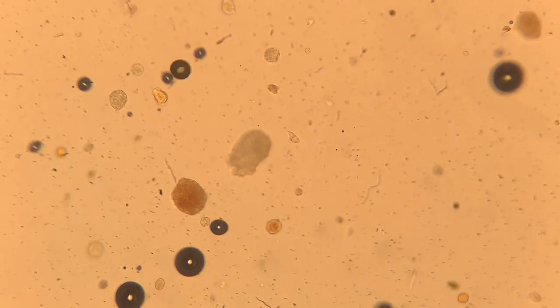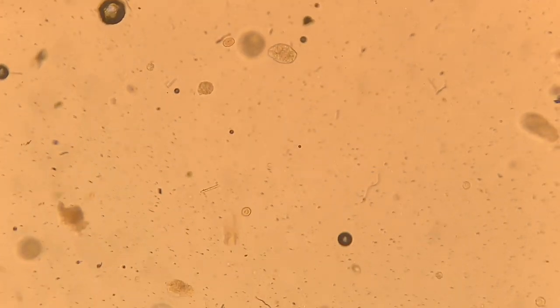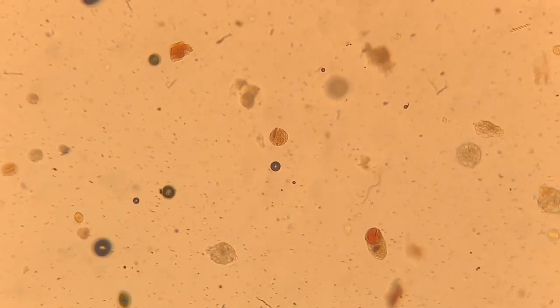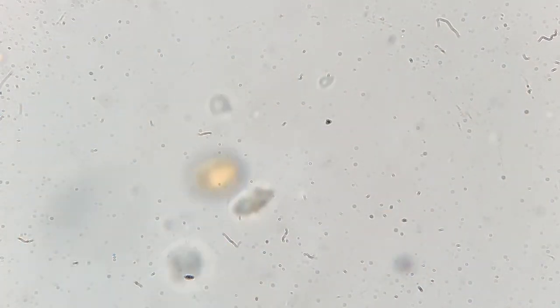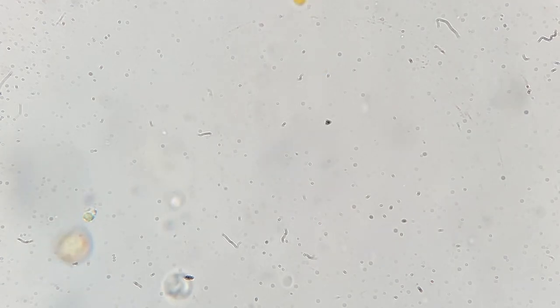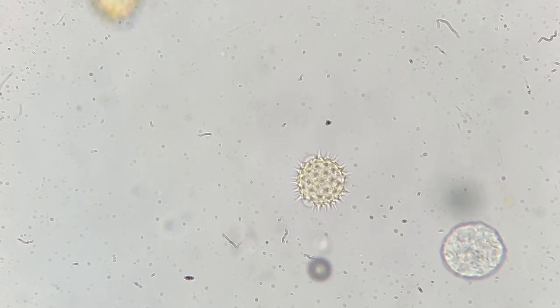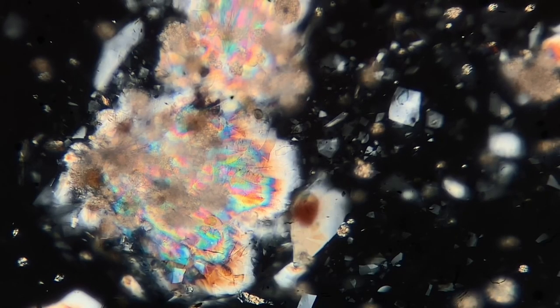Most of this debris is going to consist of pollen and spores from plants and from fungi, as well as some bacterial spores. All of this pollen in honey might look dangerous or scary, but there are some studies that show that if you eat local honey, it could potentially help with allergens. But there are certain bacterial spores in here that could potentially cause botulism for infants. So there's a reason why you don't want to give this honey to babies, because it could cause paralysis or death if it has a high concentration of the botulism-causing bacteria.